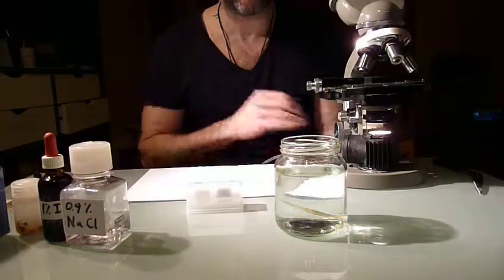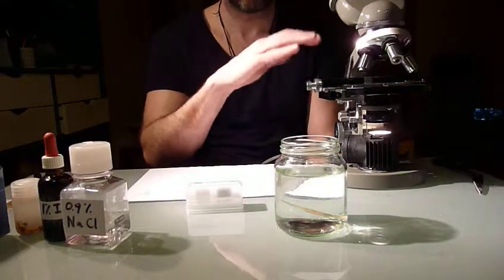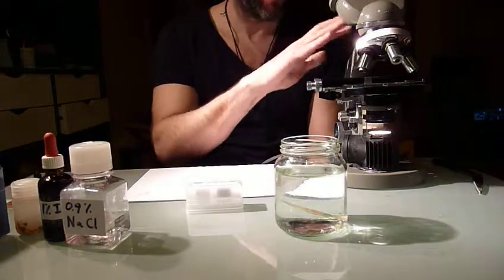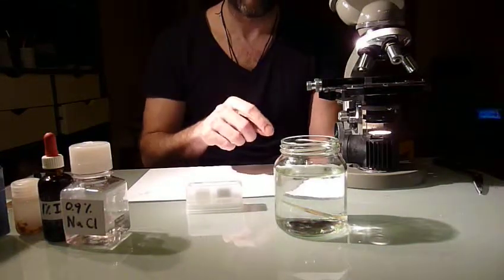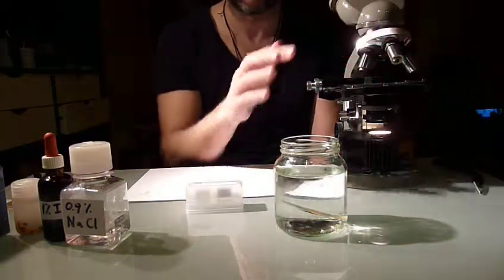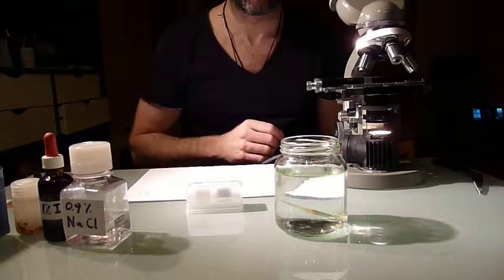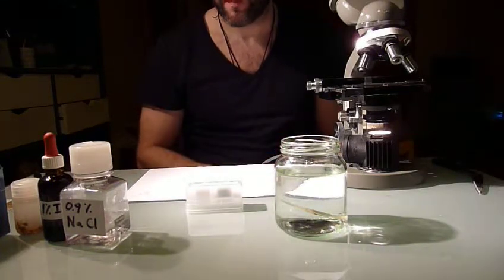So that's it. I'll post some of the video. I have a video which shows what to look for in the sample. First with the 10 times magnification, so with the 10 times lens, and then later with the 40 times lens, so you know a bit what the size should be when you look through the microscope.